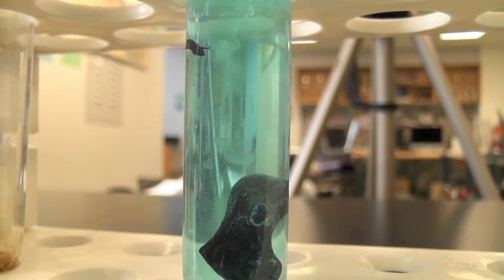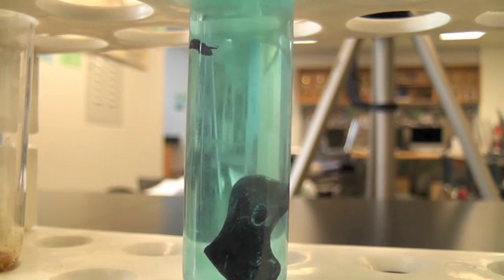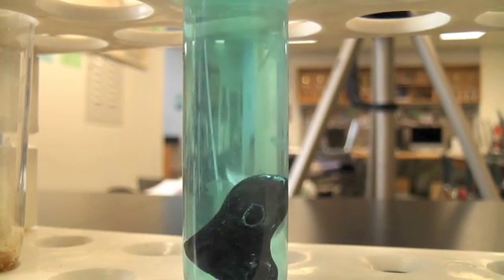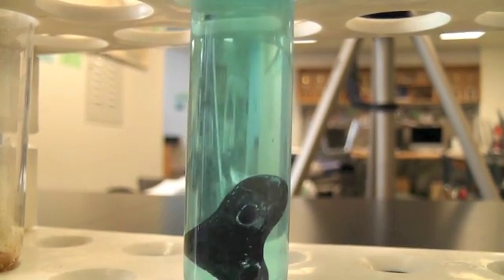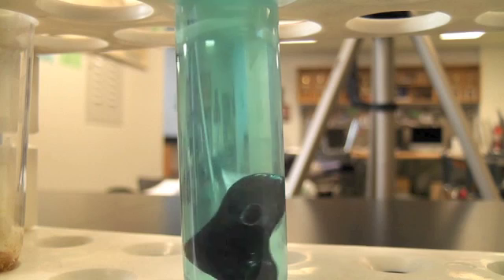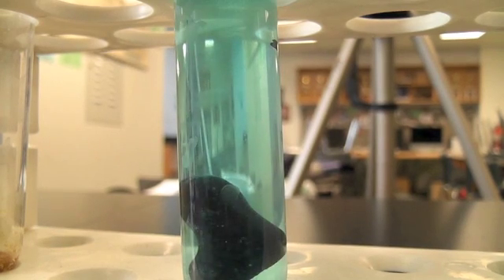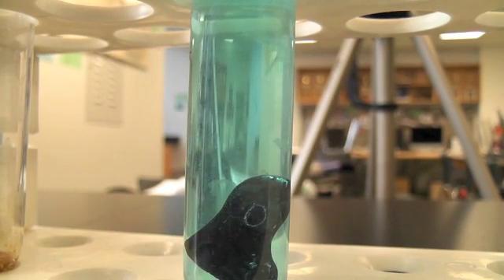Here you can see it's already starting to react. It's getting a little darker. And of course, what's happening is the copper in the solution is switching places with the lead. The lead is going into the solution. The copper is appearing as a pure metal. So on the lead, the lead's going to get dark. It's going to become a nice dark color as the copper forms on it. And if we give it some time, the color of the copper solution will slowly disappear.